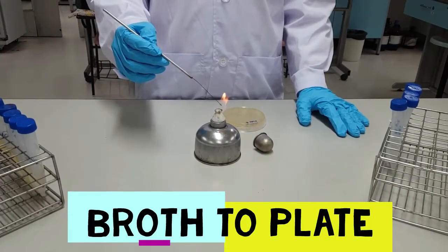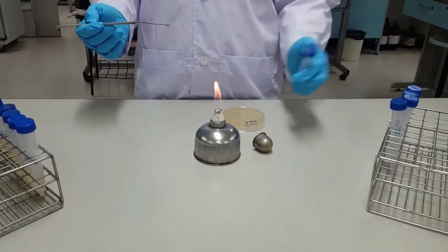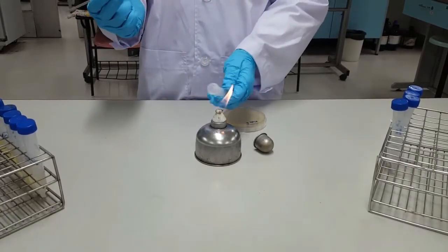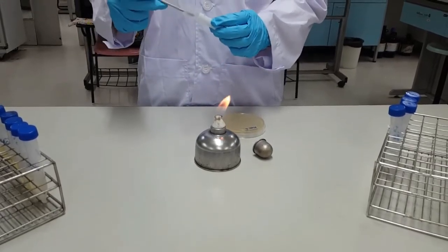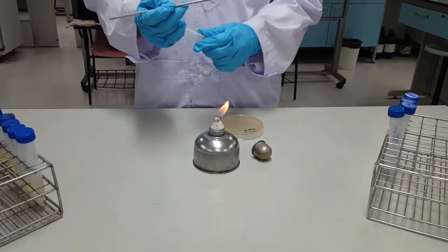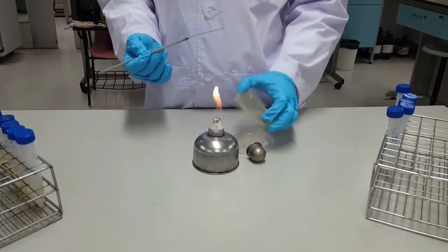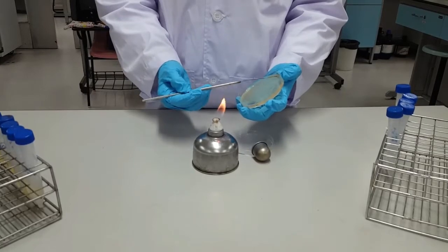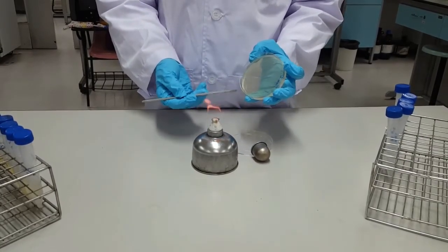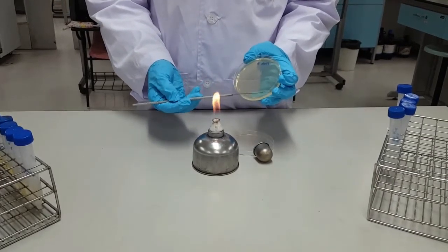Now we will move the culture from a liquid broth to an agar plate. Start by flaming the loop until red hot, flame the lid, and then remove, flame the mouth, and insert the inoculating loop. Remove and flame the mouth, replace the lid, and flame the lid once more. You want to keep the plate close to the flame, and you're going to spread across with the inoculating loop, and then you're going to want to flame the loop afterward.